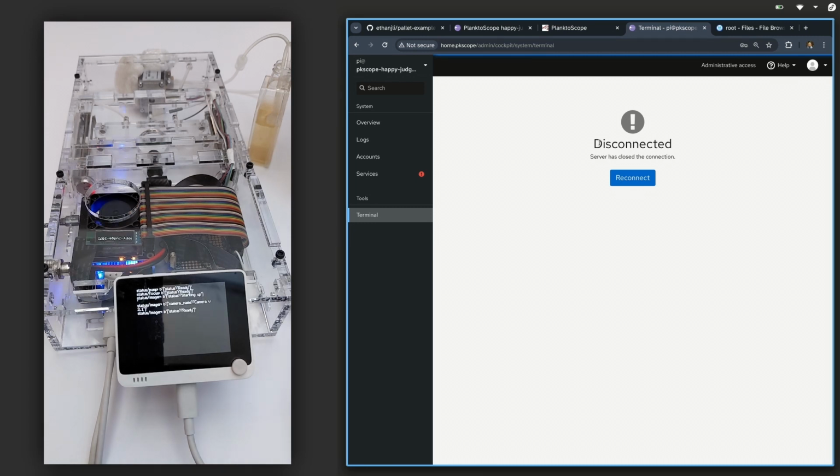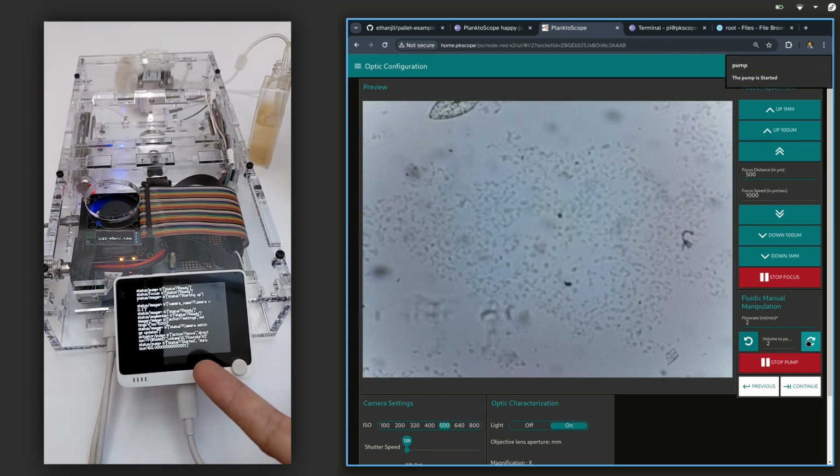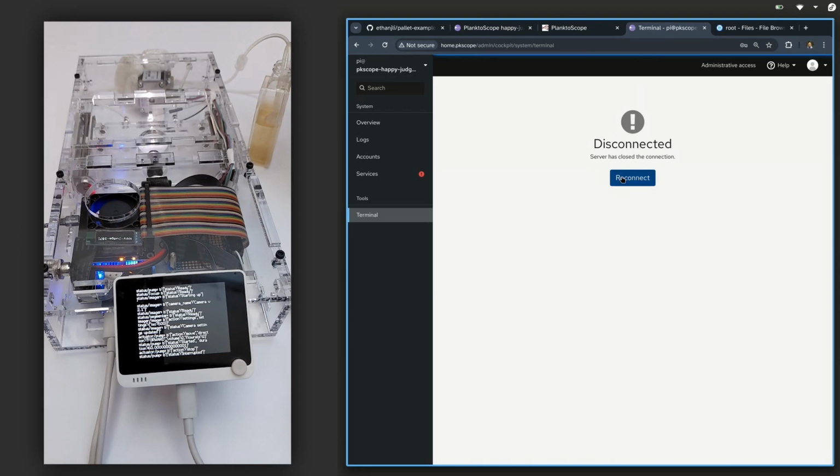And now we see that the PlanktoScope has booted up and the Python program started up and sent some messages over MQTT, and now they are being printed out to the YO terminal. So if we go back to our graphical dashboard, and now as we start running the pump, we see some messages about the pump being started. If we stop the pump, then we see more messages here. So now the software add-on has basically added support for this hardware module that I've added.